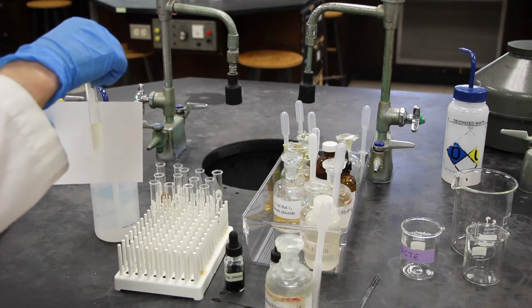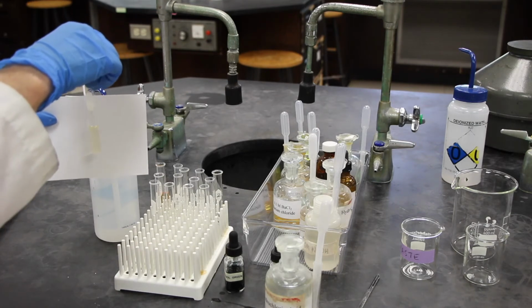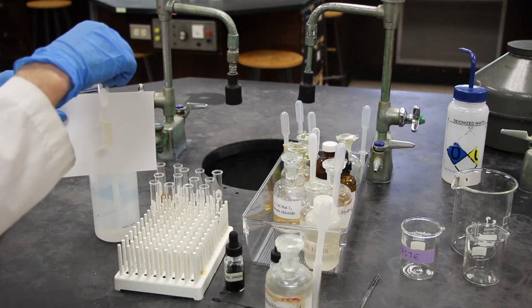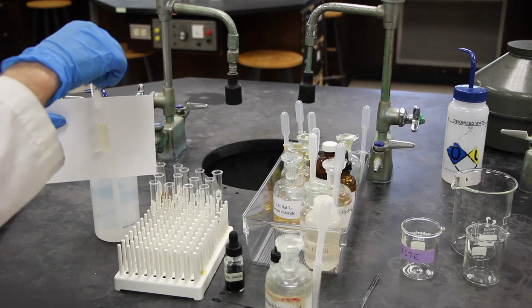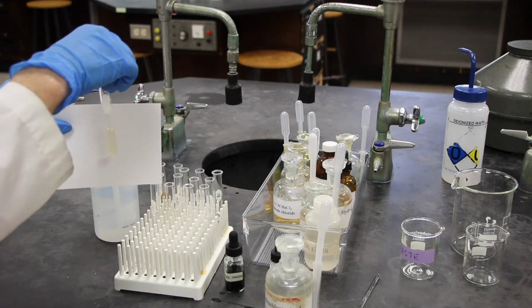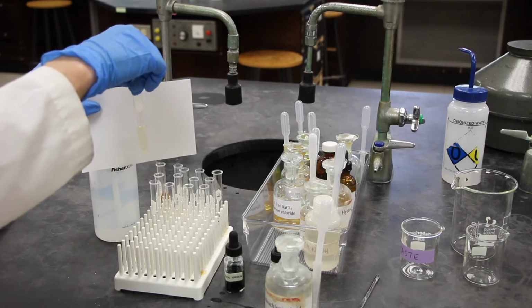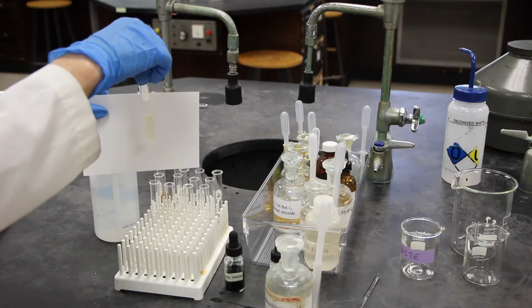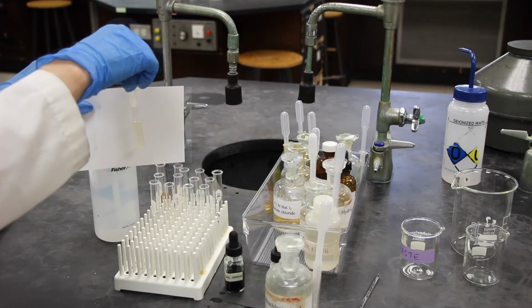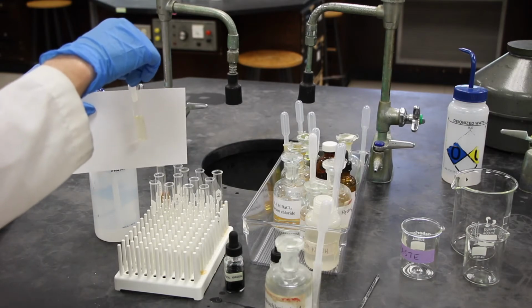Okay, hydrochloric acid is H plus and Cl minus. If you don't see either one of those in the balanced net ionic reaction, perhaps it is reacting with one of those species. Mix, record the observations, and answer question QB3. Now this can be disposed of in the sink, and I'll do that right away.